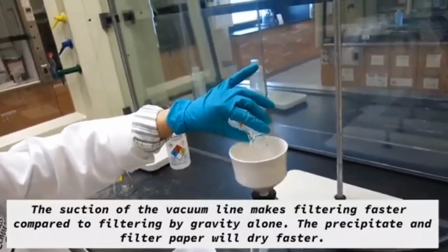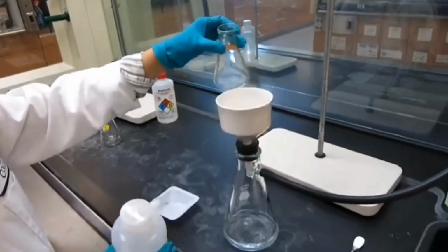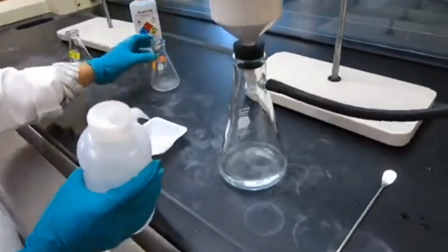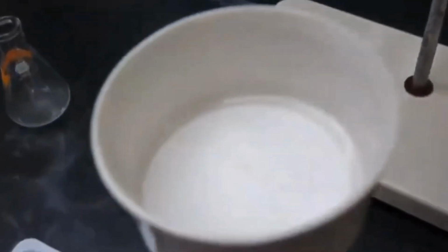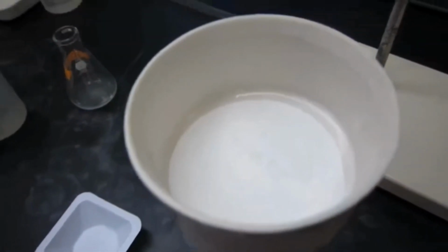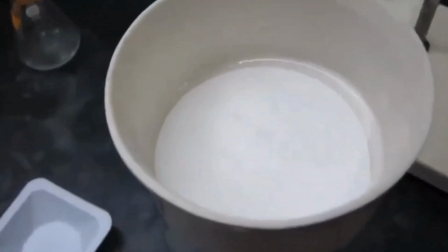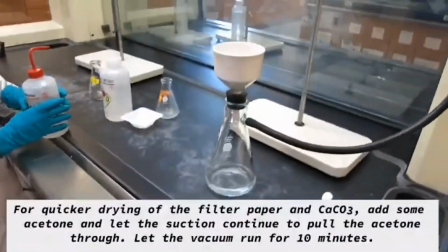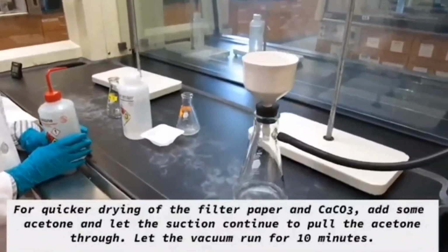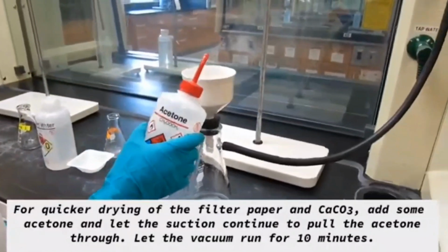And if there is any residue inside the flask, you can add a little bit of deionized water, swirl it around and pour it back onto the Buchner funnel. Now this is going to be your calcium carbonate precipitate. And where is the sodium chloride? You can see that the sodium chloride is now dissolved in the filtrate solution.